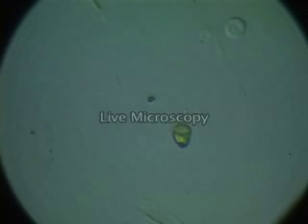The nice thing about live microscopy is that you can actually see the color and the movement of the cells. What we just saw are green algae occurring in sea ice, and you can nicely see the green color of the chloroplasts in this recording — you just saw one swimming through. They are very fast, and even at temperatures of zero degrees they swim at rates of several body lengths a second.